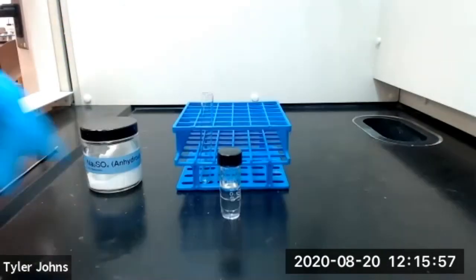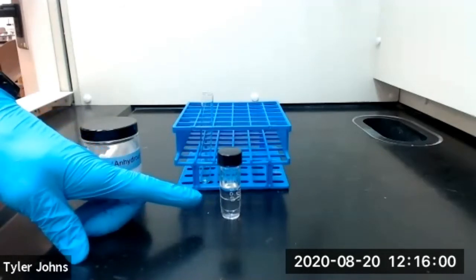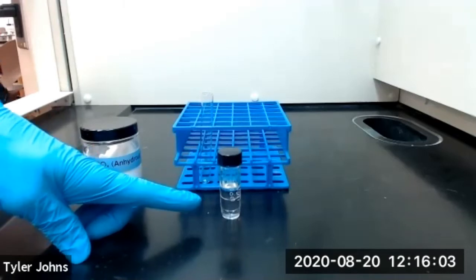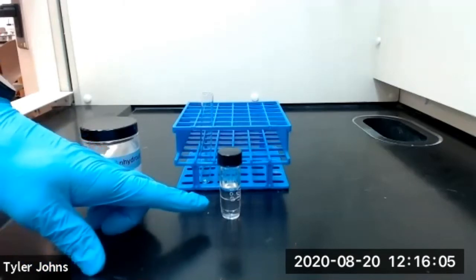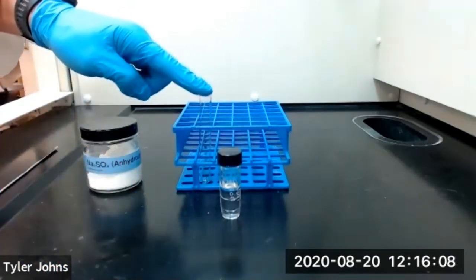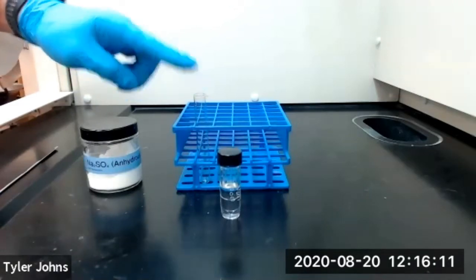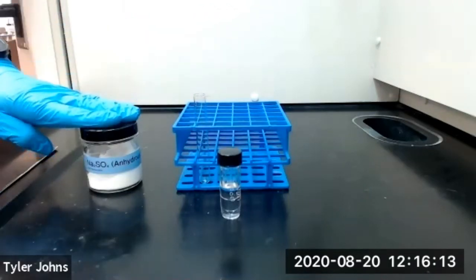Now that we've thoroughly mixed our benzoic acid with the two milliliters of water and two milliliters of methylene chloride, we're going to remove the bottom organic layer and transfer it to a clean test tube, then dry that organic layer with anhydrous sodium sulfate.